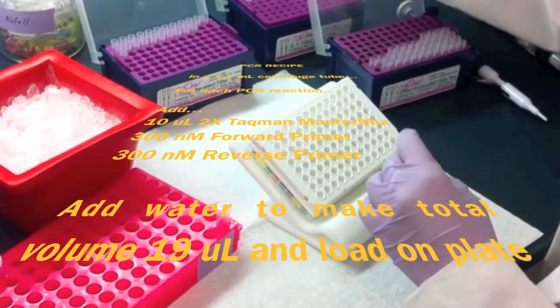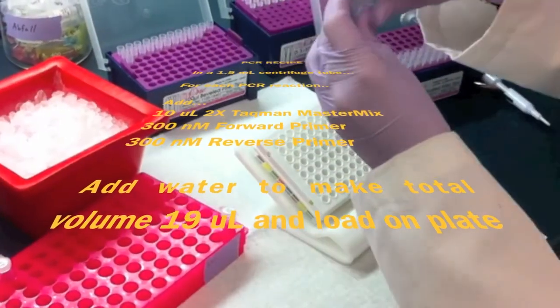Then, add reverse primer at 300 nanomolar to the target gene MasterMix probe.